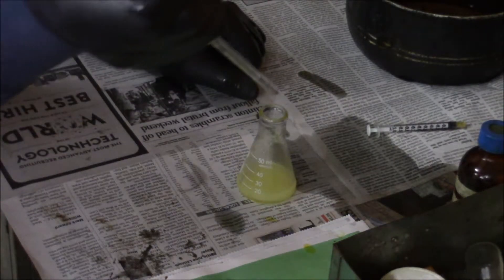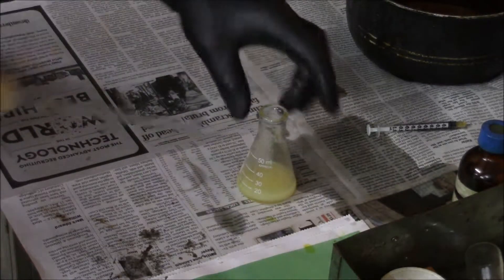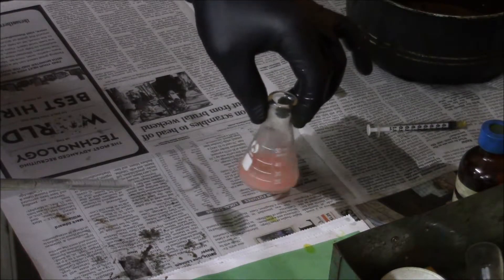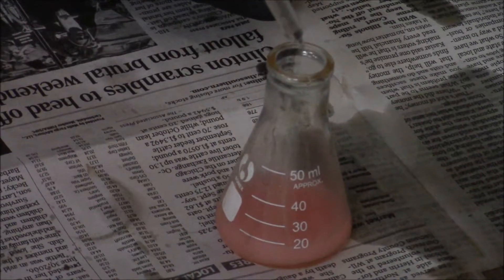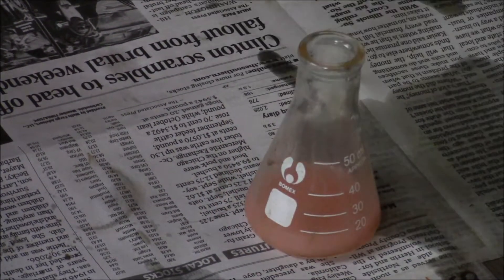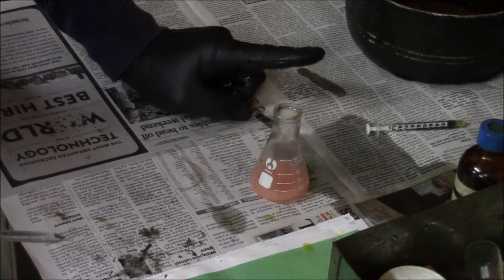It's still yellow, so I'm going to continue to add. I can see it trying to change color. And there — it does change color. I would safely say that if I added the remainder of that one milliliter, I would have had the color change. So I'm going to call the titration number of this oil sample a one.